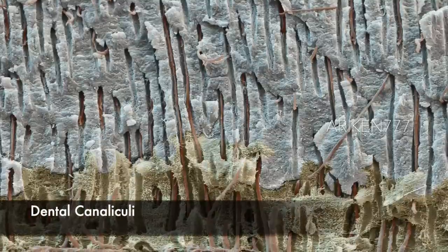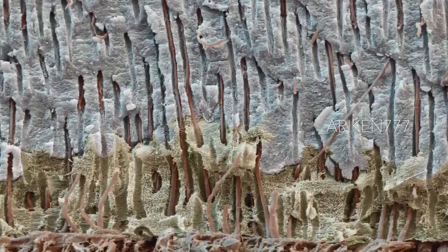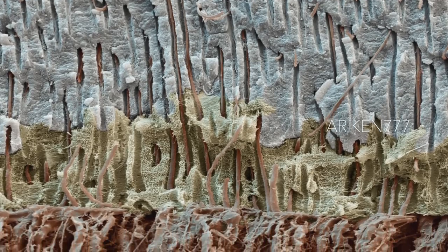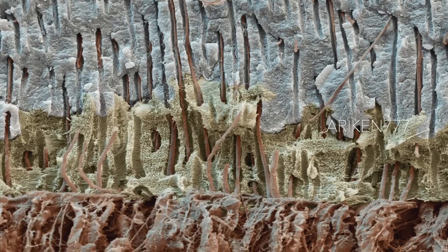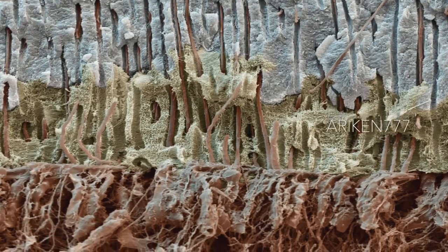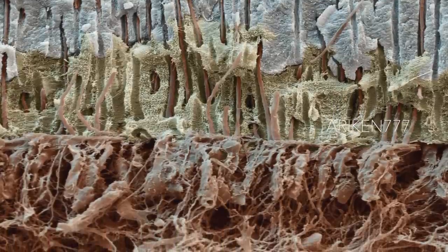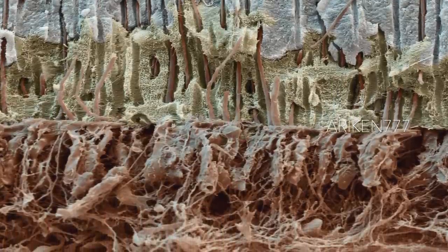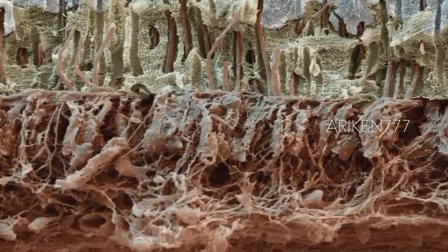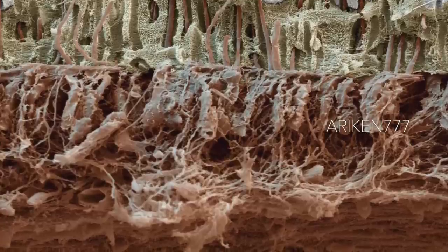This image shows the boundary between the yellow dentine, which is mineralized connective tissue found under a tooth's enamel, and the pulp. The pulp, the soft tissue containing nerves and blood vessels that make up the inner part of a tooth, has been removed to reveal the dental tubules or canaliculi. These tubules are minute holes in the dentine formed by the cytoplasmic extension, shown in pink, of odontoblast cells or dentine-producing cells. The odontoblast cells originate in the pulp and allow the dentine to rebuild itself, unlike enamel.